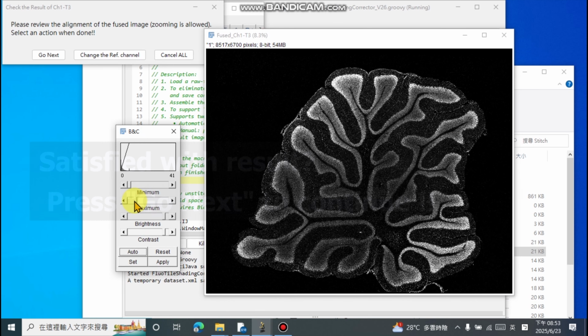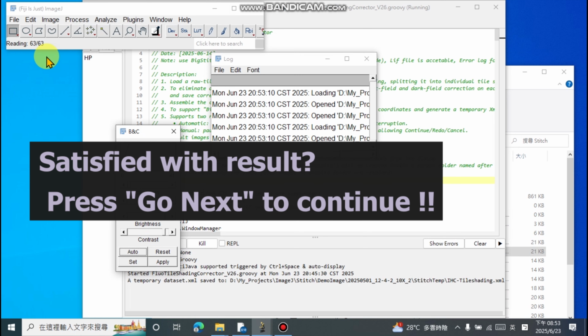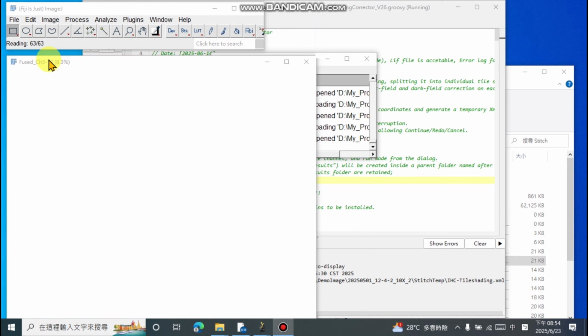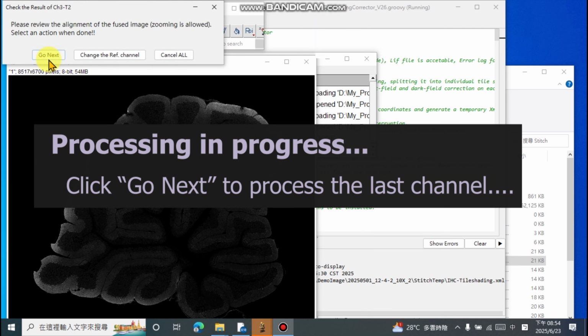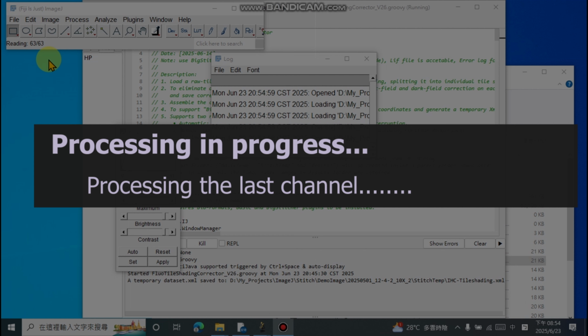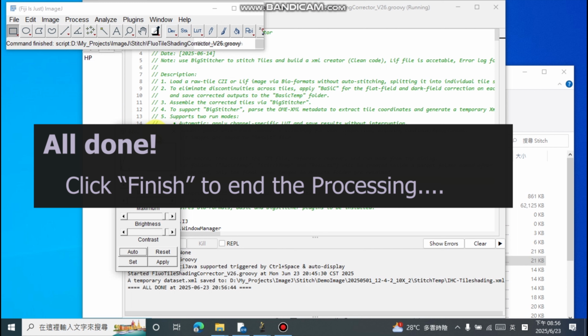If the stitching result is acceptable, please click on Next Channel, and the program will process the next channel image. OK, we click on Go Next to continue processing the final channel image. Finally, once all channels are complete, click Finish to conclude the process.